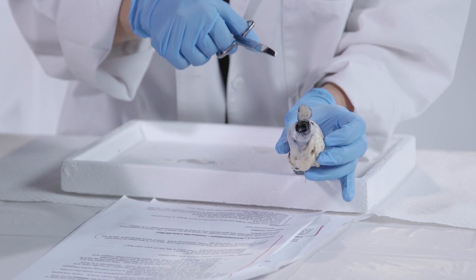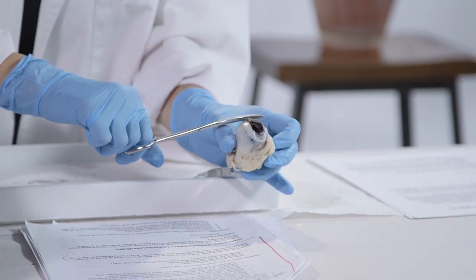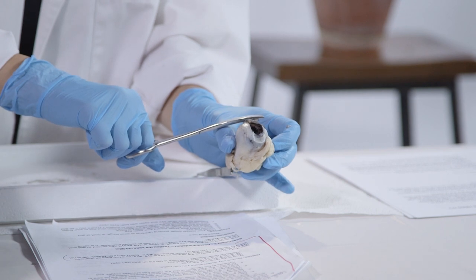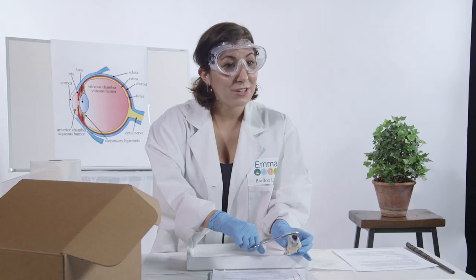The lens, which is the ball-shaped structure behind the pupil, is usually clear and flexible to help us see close and far away. Sometimes, it's really bouncy. Give it a try.